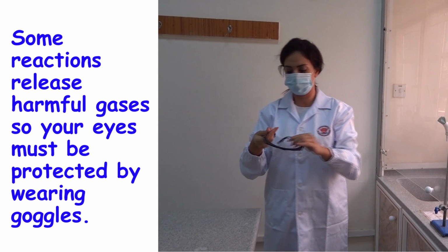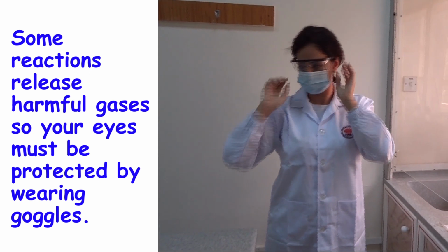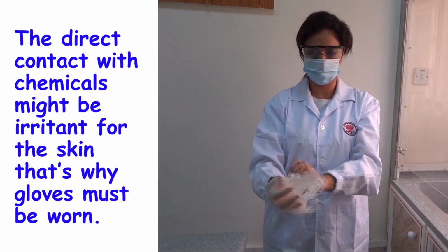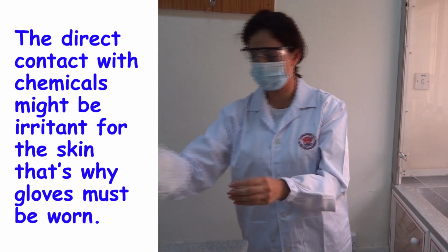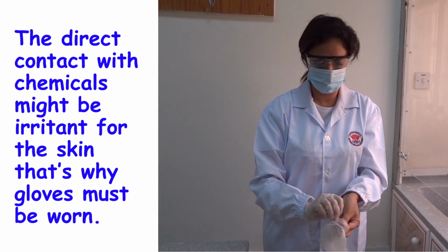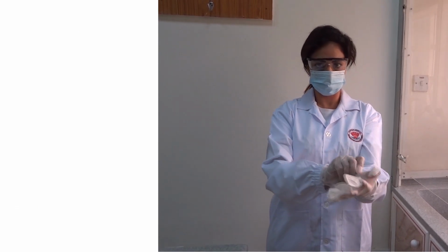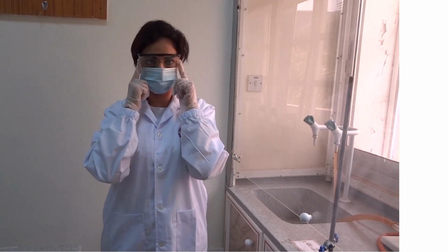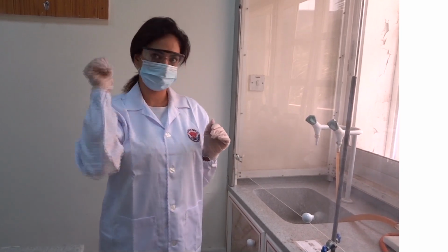Some reactions release harmful gases, so your eyes must be protected by wearing goggles. The direct contact with chemicals might be irritant for the skin. That's why gloves must be worn. Now you are ready to enter the lab. Let's discover the lab tools together.